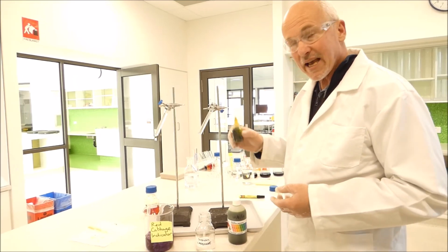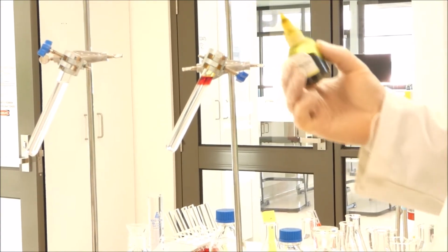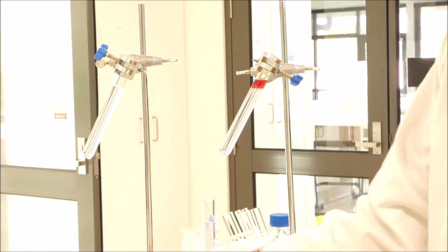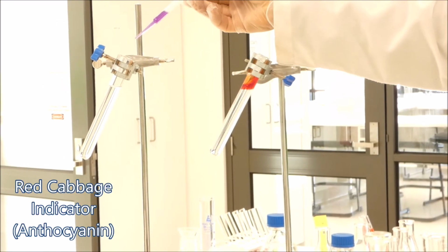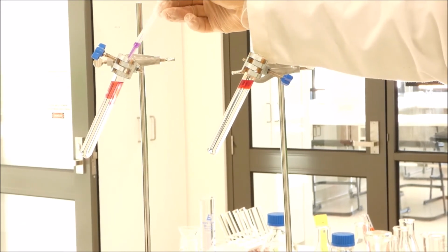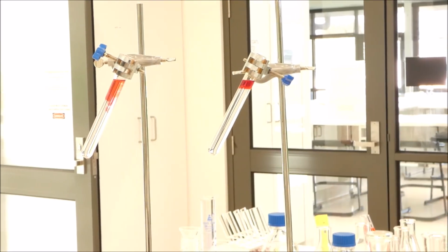We're going to add the indicator to each tube, so we'll add a few drops of universal indicator to the top of this one, and you'll see that the top turns nice and red. And we'll add a few drops of, or a bit more because it's not as concentrated, red cabbage indicator to the top of this one, and it'll turn nice and pink. Okay, so we've got the two indicators in the solution.